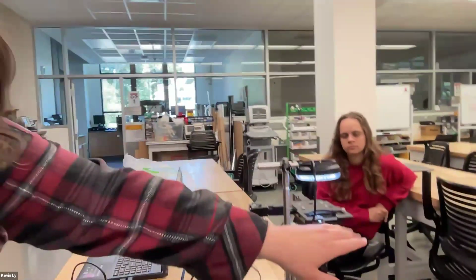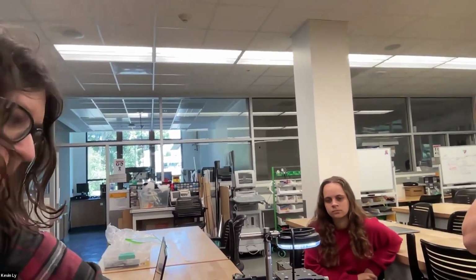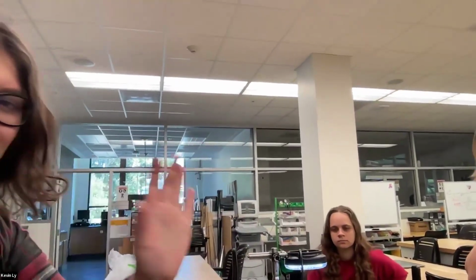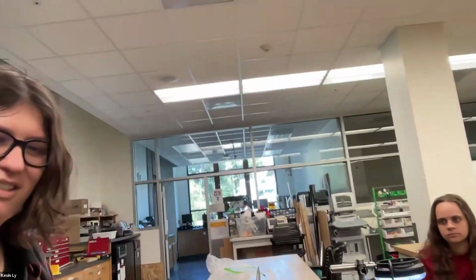In a more general sense, you have your sample here, and then this whole column is basically a series of lenses to make sure the light is focused and magnified at the point of the camera. All of microscopy is just figuring out how to get as much light as possible through the sample, and then as magnified as possible, without distorting or blurring the image. That's the gist of it.